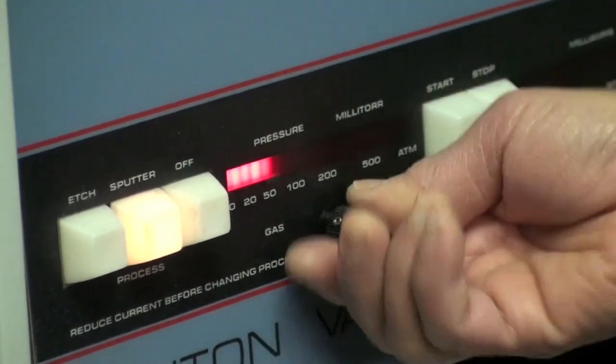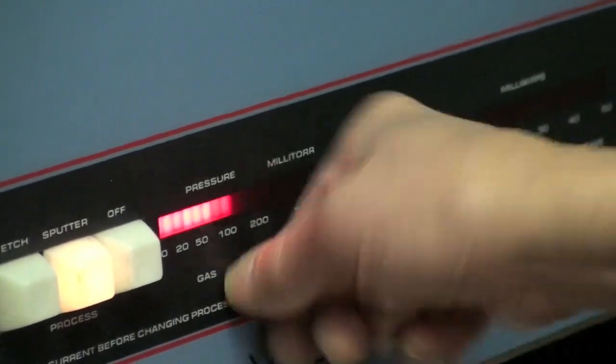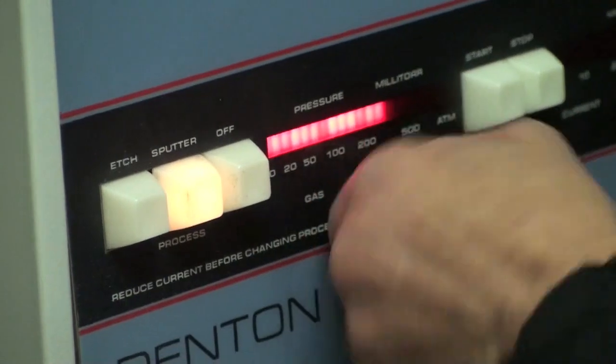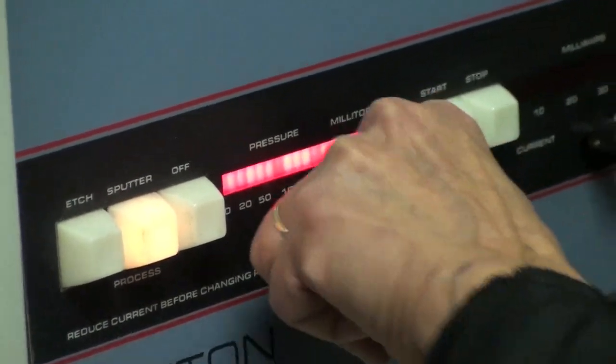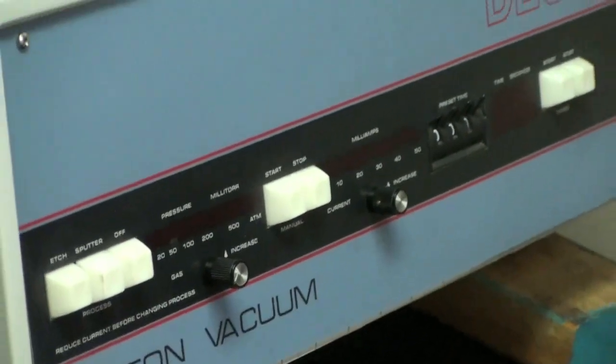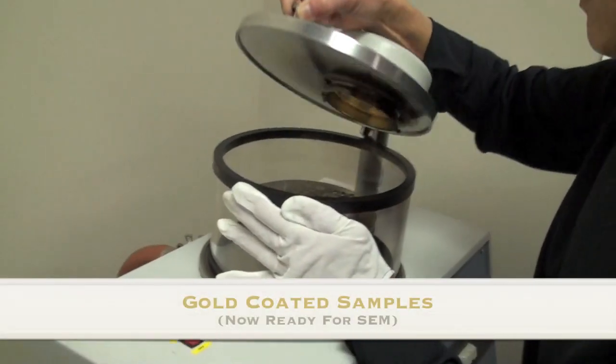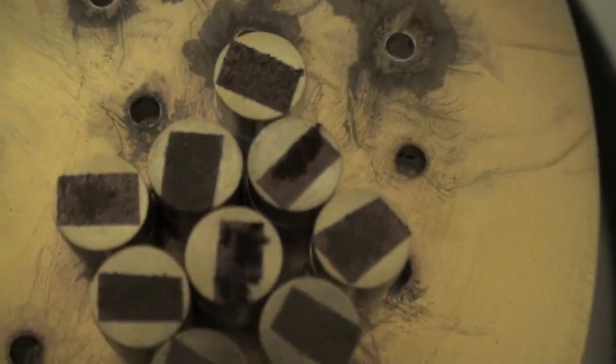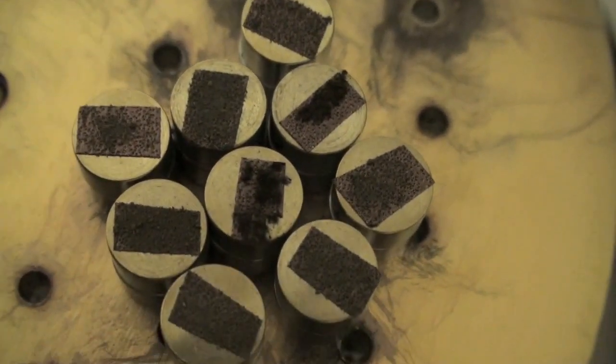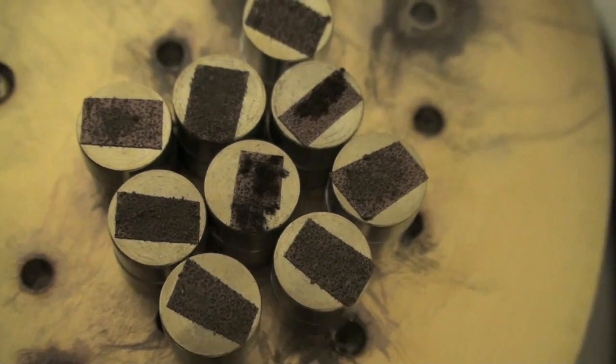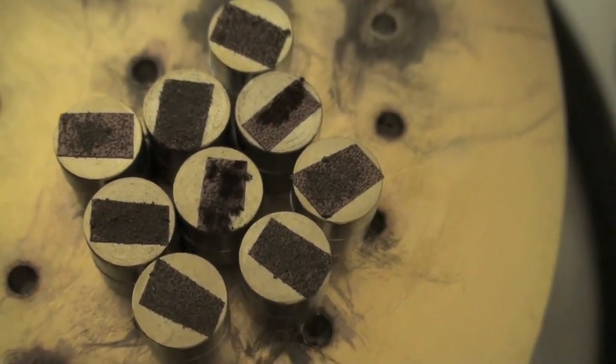You can open this. You flush the system with argon. And immediately you should turn it off because you're going to check it out. Turn this one off. You're done. It doesn't really look that good. No, it is, but it does go in there. We will see.